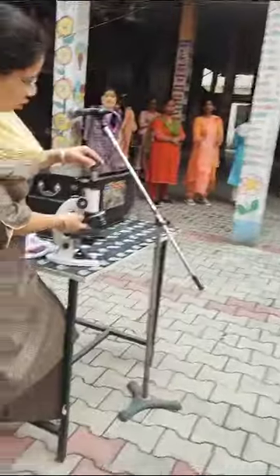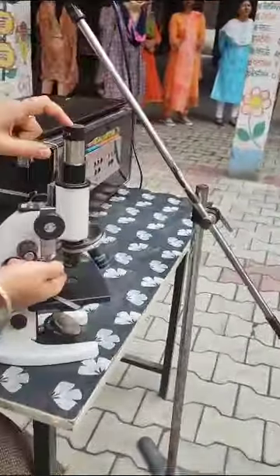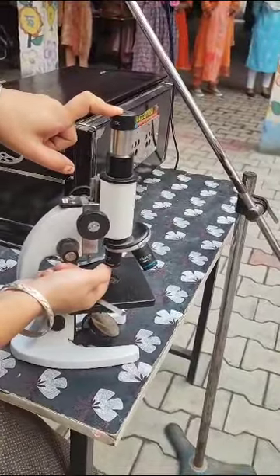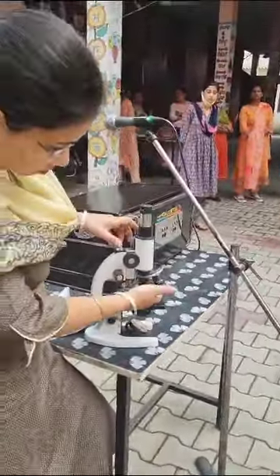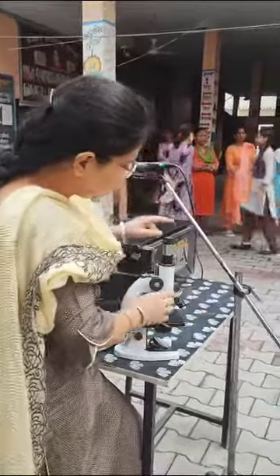The parts of the microscope include the objective lens, the nosepiece, and the eyepiece.